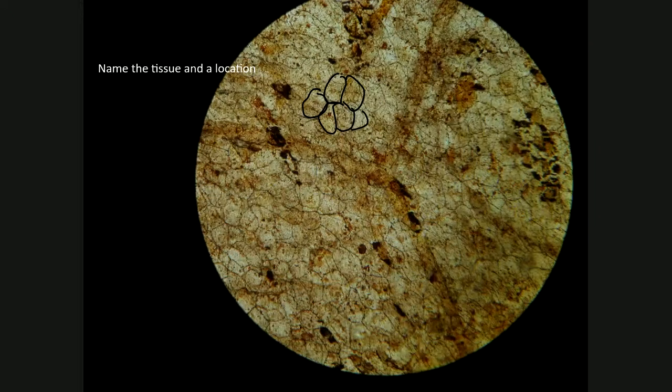This looks like a tile floor of cells. So the lines that you see are more an optical illusion, or they are made by the cell membranes of all these cells, than true protein fibers. So these are really not fibers that we're looking at. These lines that you see are actually cells. So this is a cellular tissue.